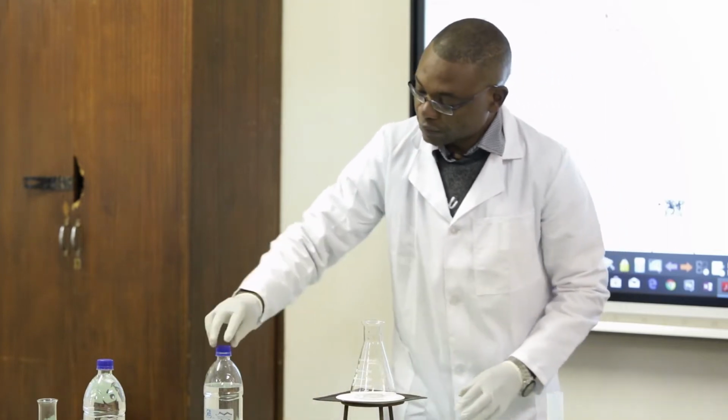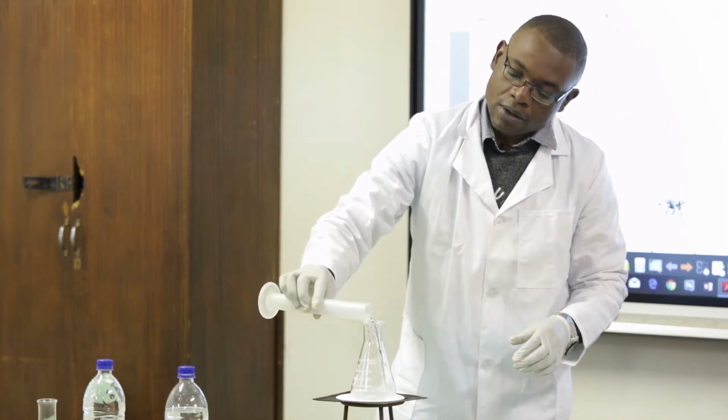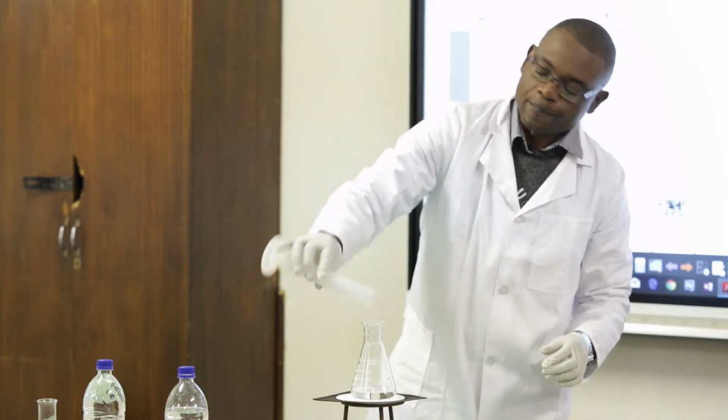There we are. And then I put in the remaining 50 mils of this.